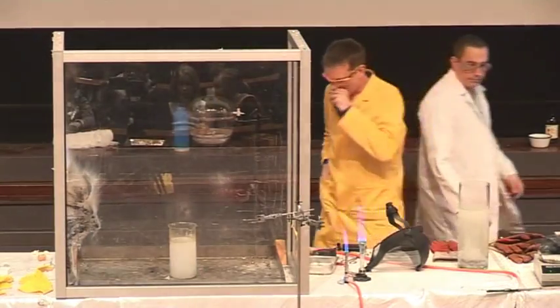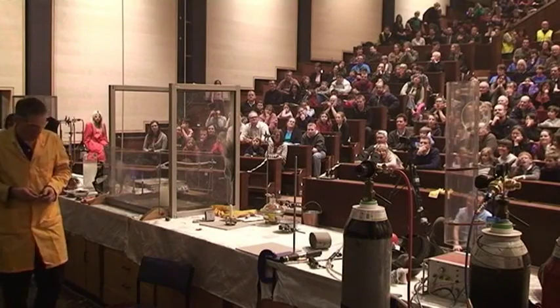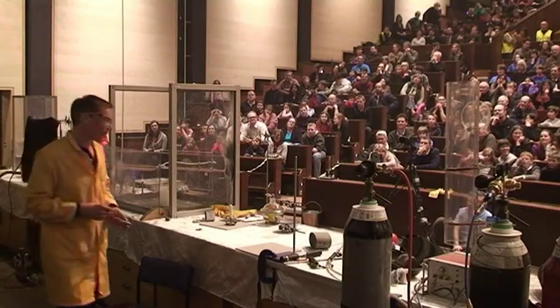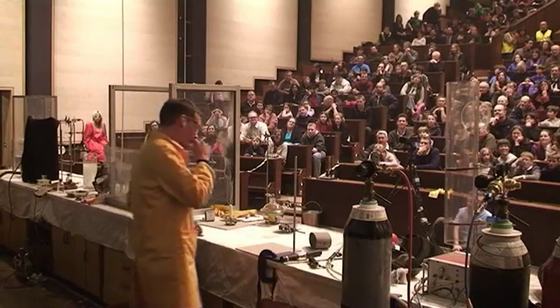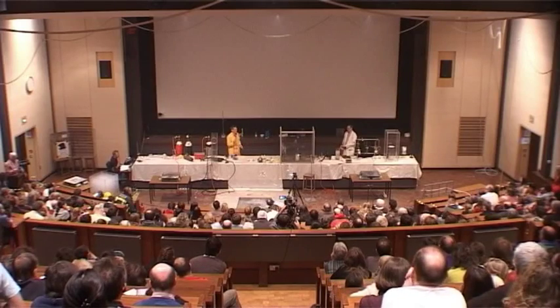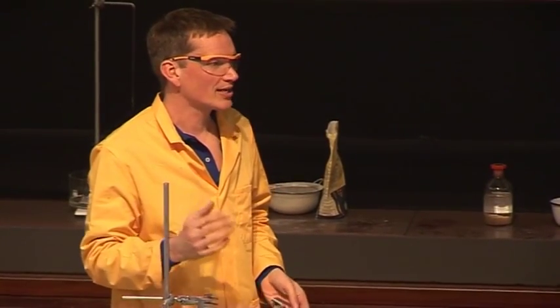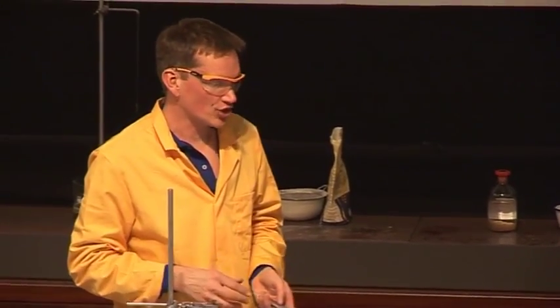Now then, very nearly finished. But I just wanted to show that everything we've seen reacting so far has all had oxygen in it. So all the burning reactions we've had have had oxygen.